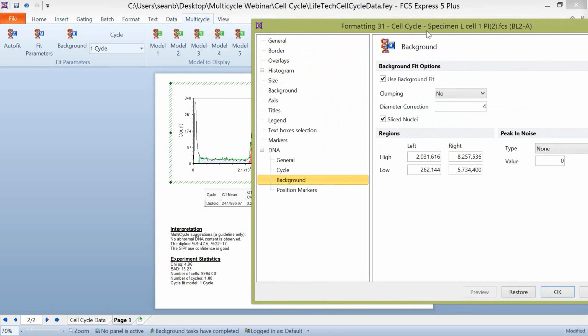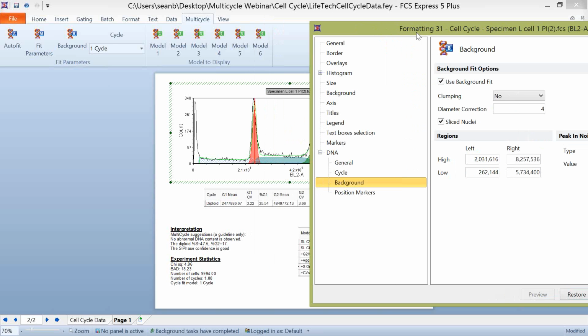And all of this information about background fitting, we could talk for a very long time about this, but it's all outlined on the Novo software website. I'm going to give you the information about where you can find, again, what these different models can do and how the background fitting options can be applied to your data. But I think it's just important in general to know that these exist here, and that if you want to use background fitting or if you determine that you don't want to use it, you can simply come in here and uncheck it. Again, you can also access this through the Multicycle tab through the background button right here.